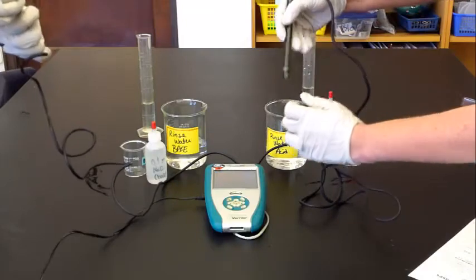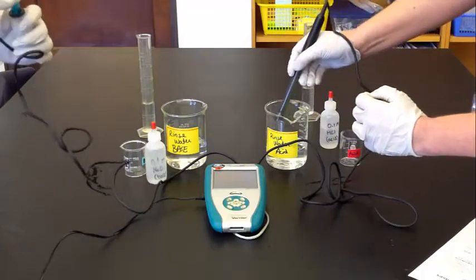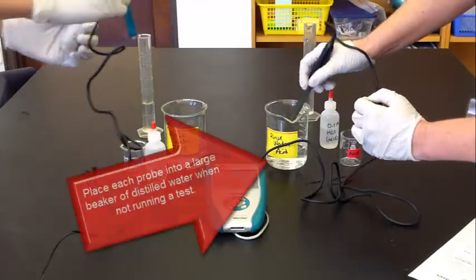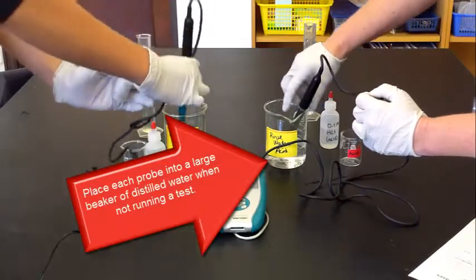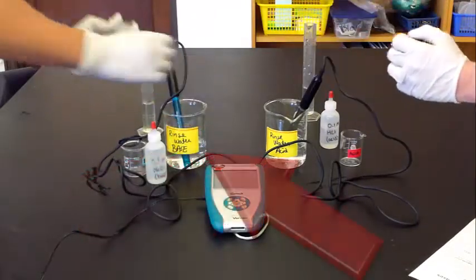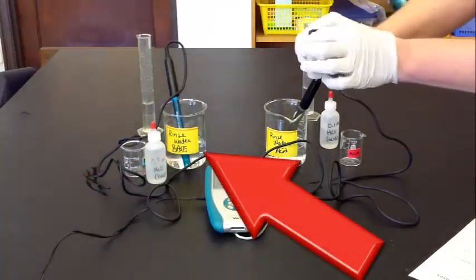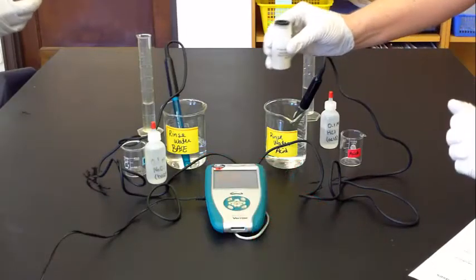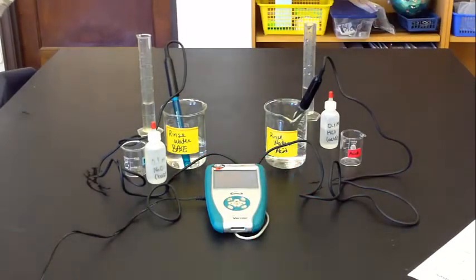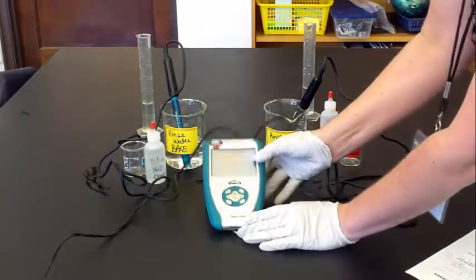Tightly pull it out, and then I have waiting a beaker of rinse water—distilled water—and that's what we're going to keep it in when not in use. Then we're going to put this in a safe place on a shelf, and your teacher will show you where to do that.